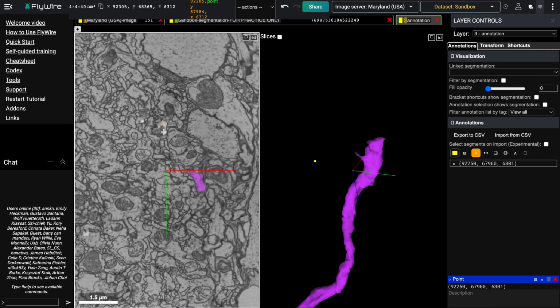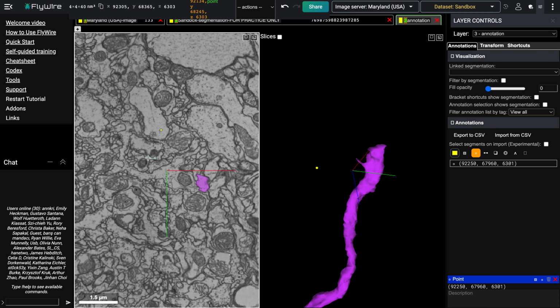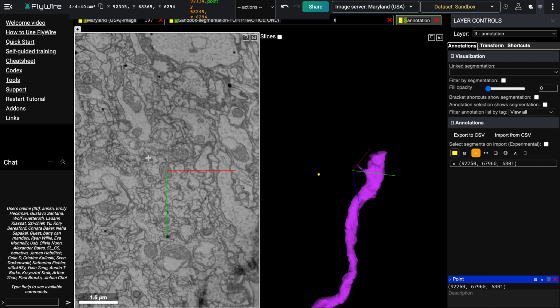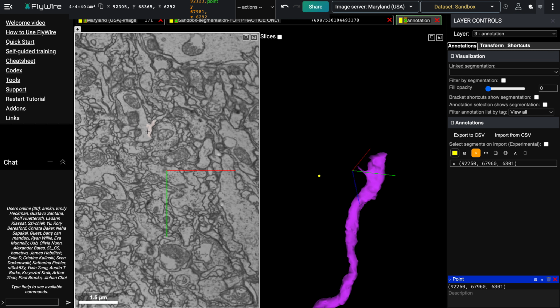And then it looks to me like this object is just shifting a bit to the left. So it looks like it's this thing here, and as I go slide by slide, you can see that a little bit more clearly. You can see the shift happening right here, and then I'm going to scroll a little bit and place another annotation point here.